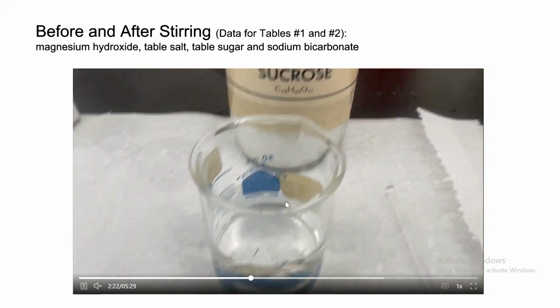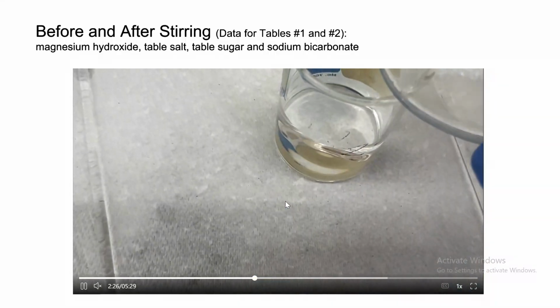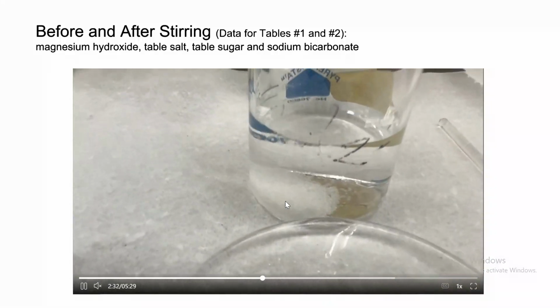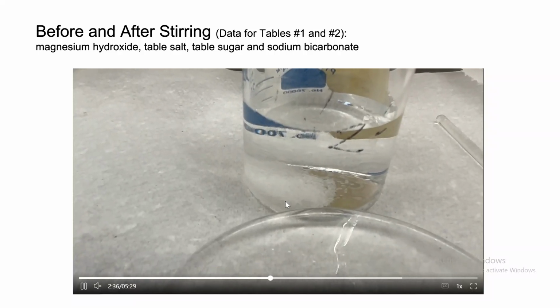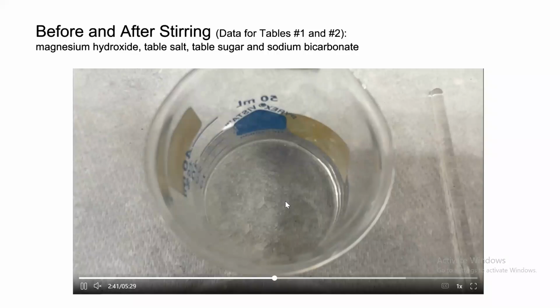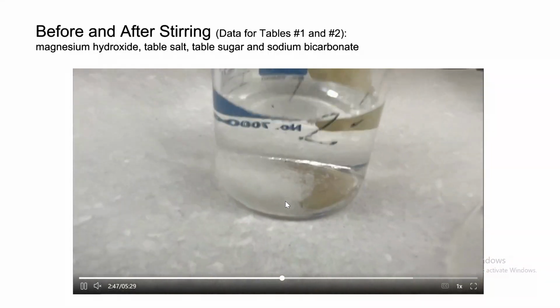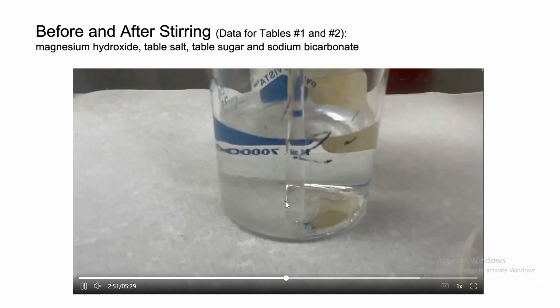Now let's do sucrose. Sucrose, which is table sugar. We're gonna add sugar to water. As you can see, when we add sugar to water, again, it goes all the way to the bottom. So for table 1, the observation would be sinks. And because it sinks, that means sugar, which in our case is sucrose, is more dense. See, it's going to the bottom.